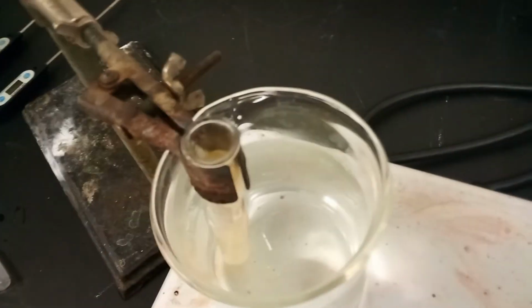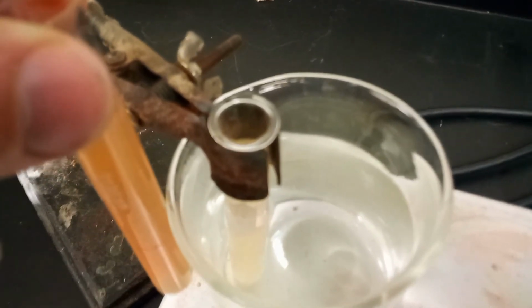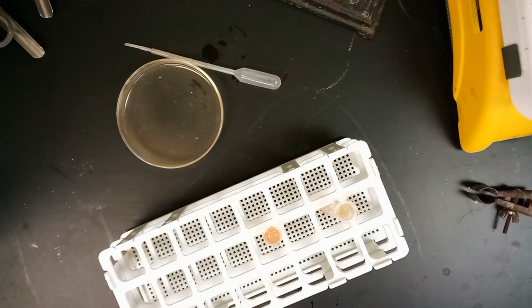5 minutes later, here's what our test tube looks like. You don't want to pick this one up because hot glass looks just like cold glass. That's probably some pretty hot glass. So we bring test tube A over, and you'll see, hopefully, that the one on the right is way lighter, which tells us that there are more reactants present now that we've added heat to the reaction. Because the potassium thiocyanate is clear, and that is a reactant, as opposed to the complex ion of the iron thiocyanate ion, which is that dark red that we've seen earlier on.